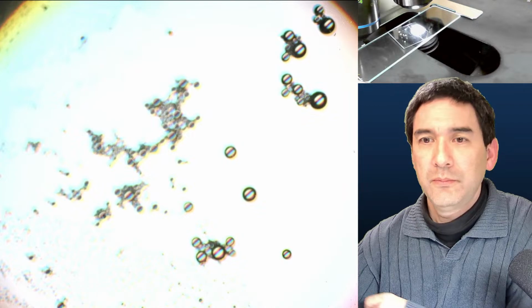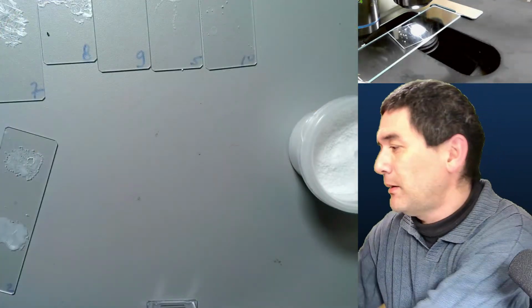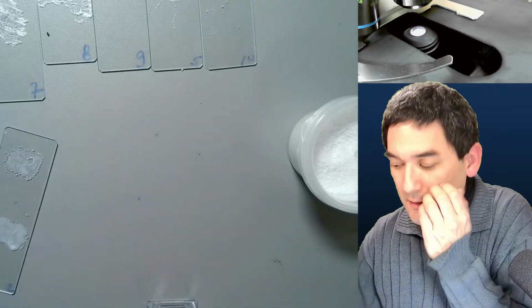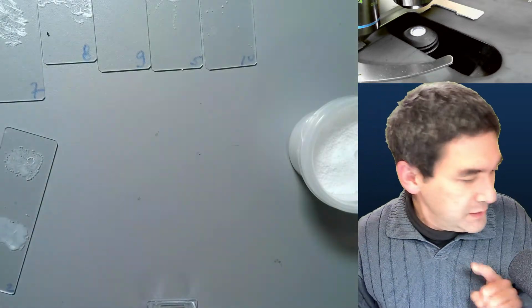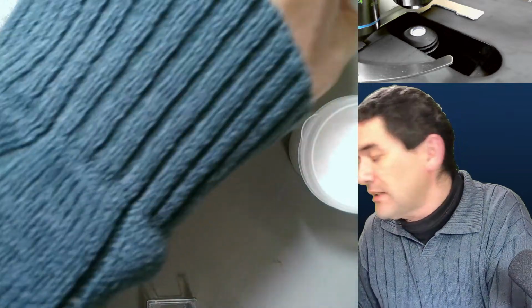Simply because you wanted to know about some of the bubbles. Okay. So let's put this away again. Let's start to have a look at some of the others, because what time is it? It's already 38 minutes. So number 2 is ascorbic acid, vitamin C. There is another vitamin C slide that I've got here, because vitamin C is actually quite a nice specimen to look at.